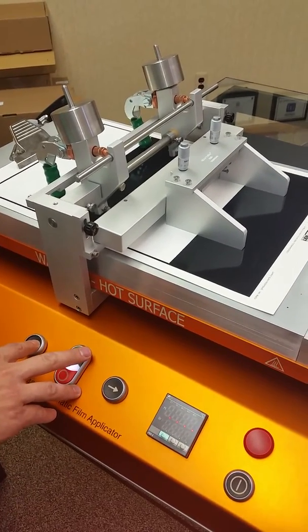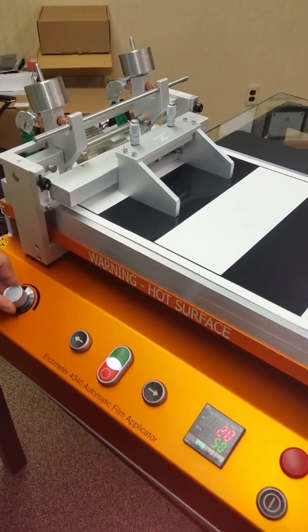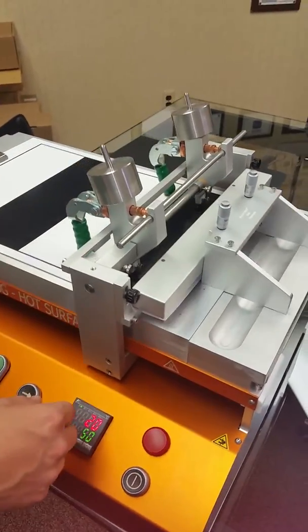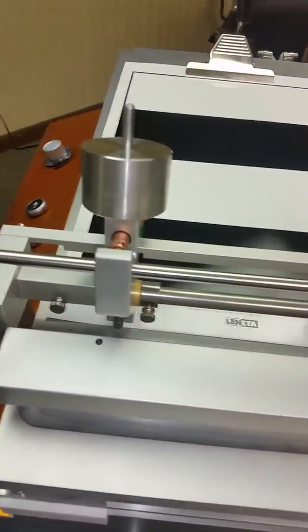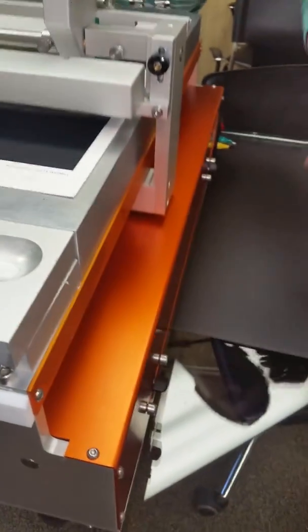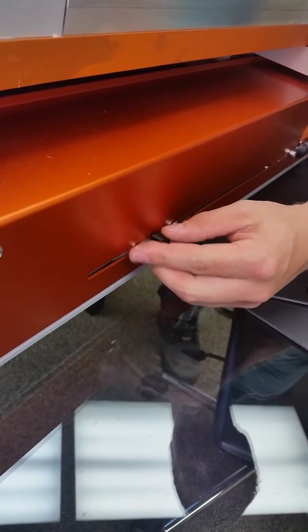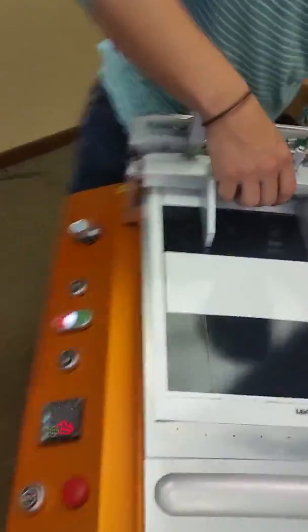Push it back. You can adjust the length that you want to travel to — that's not all the way to the end of the table — and now it will stop at that spot.